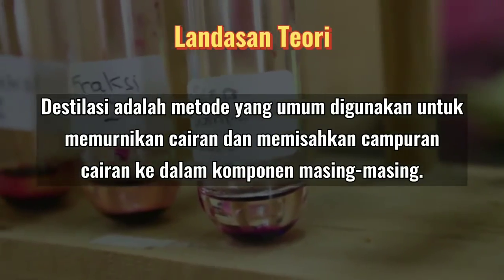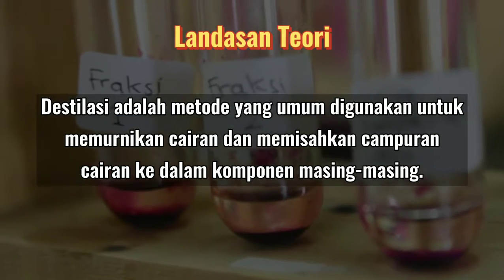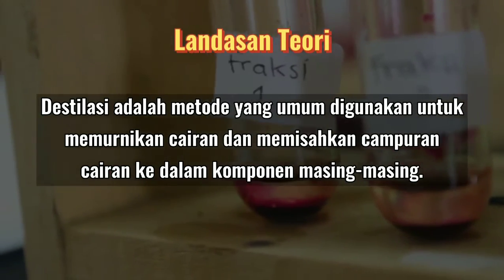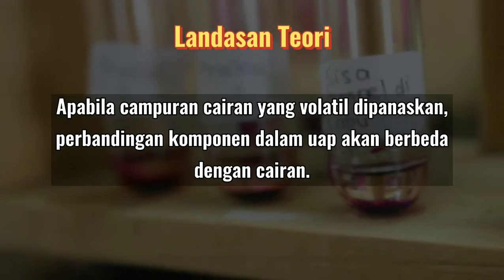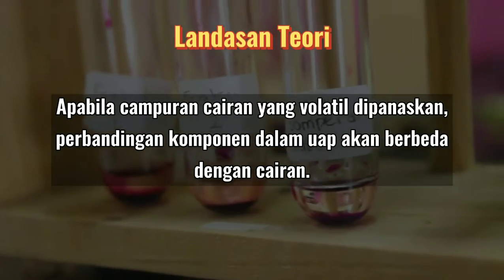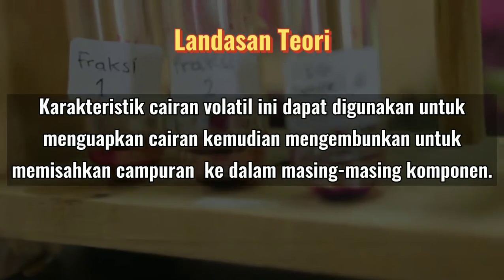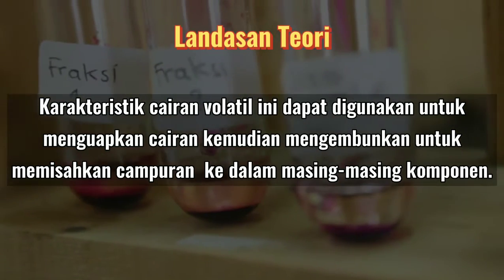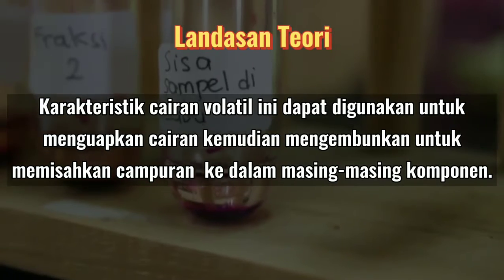Destilasi adalah metode yang umum digunakan untuk memurnikan cairan dan memisahkan campuran cairan ke dalam komponen masing-masing. Apabila campuran cairan yang volatil dipanaskan, perbandingan komponen dalam uap akan berbeda dengan cairan. Karakteristik cairan volatil ini dapat digunakan untuk menguapkan cairan, kemudian mengembunkan untuk memisahkan campuran ke dalam masing-masing komponen.